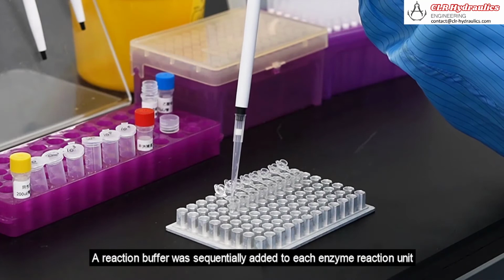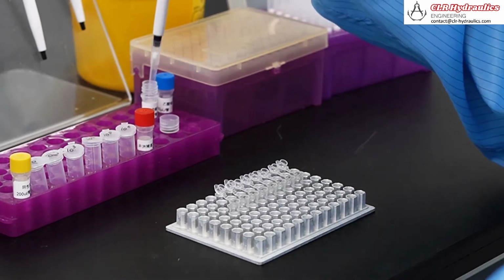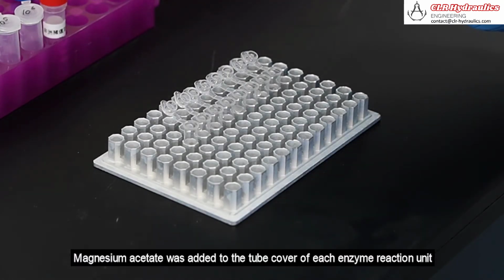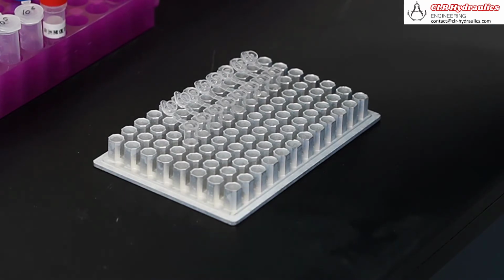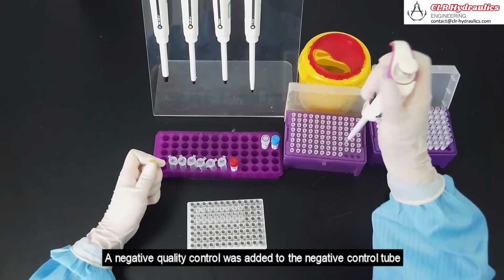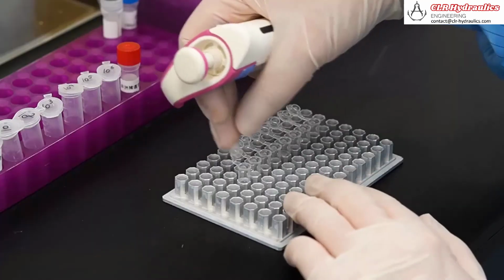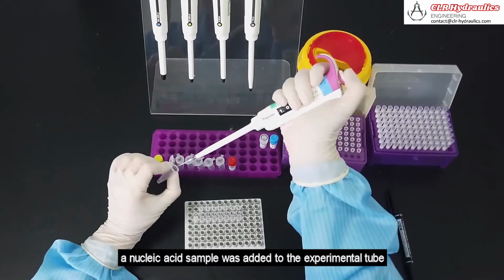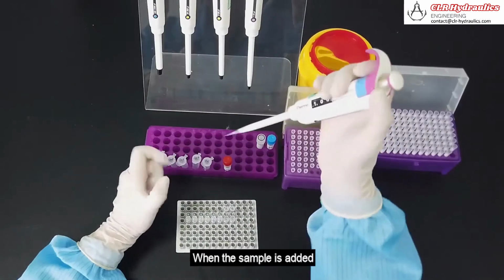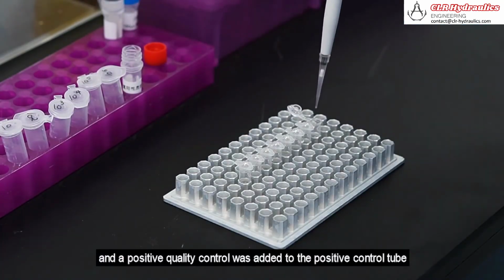Reaction buffer was sequentially added to each enzyme reaction unit. Magnesium acetate was added to the tube cover of each enzyme reaction unit. A negative quality control was added to the negative control tube. A nucleic acid sample was added to the experimental tube. When loading, it is necessary to add samples according to the sample concentration from low to high. When the sample is added, the lid of the reaction unit needs to be buckled to prevent cross-contamination, and a positive quality control was added to the positive control tube.